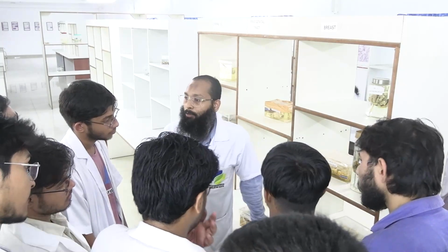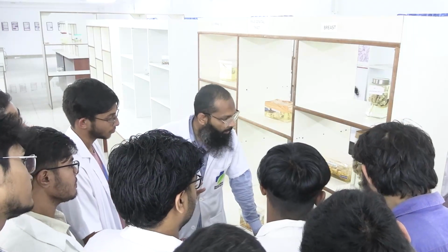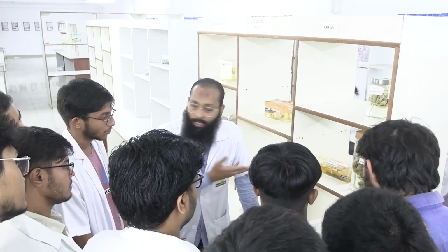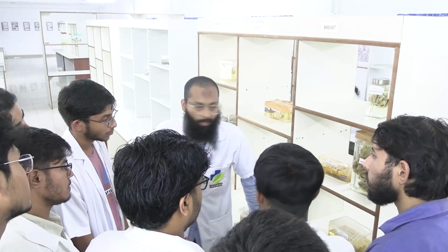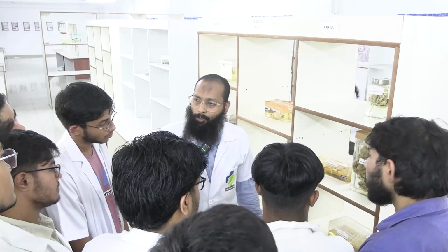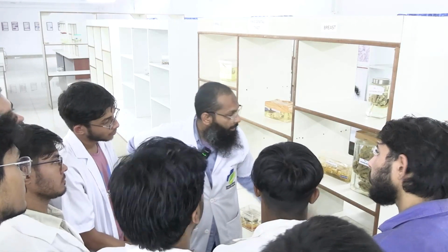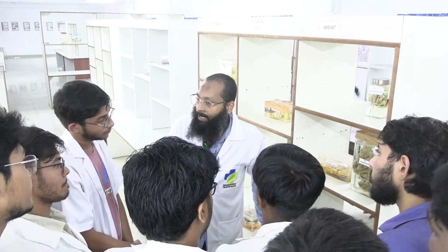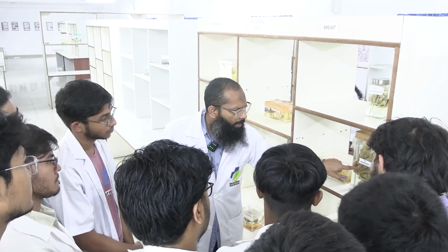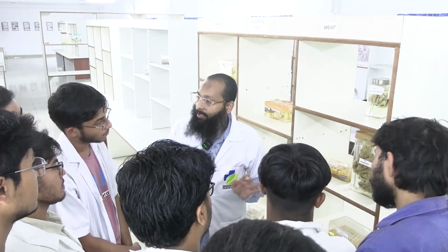This whitish appearance is not normal for the breast. Okay, so this is definitely a mass. Now you can describe the mass depending on the size. You can tell the size, you can give an approximate dimension. Like I can say it seems to be 7 centimeter by 5 centimeter or 4 centimeter. Approximate you can give. Now you can describe the color, whitish in appearance. You can describe any abnormal areas, like if there are some blackish or reddish areas present, you can describe it. But here it is uniformly whitish in appearance.